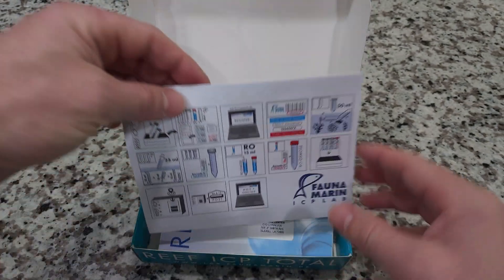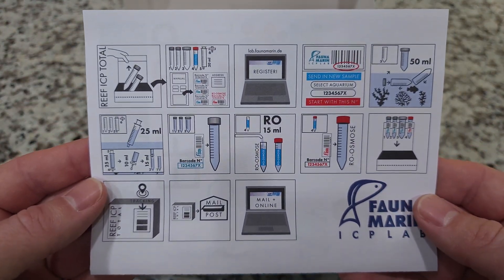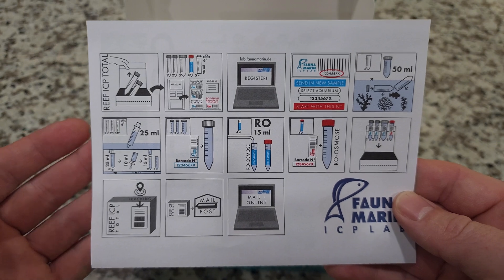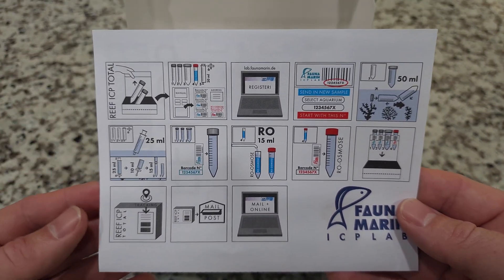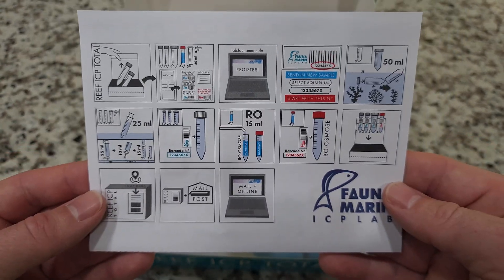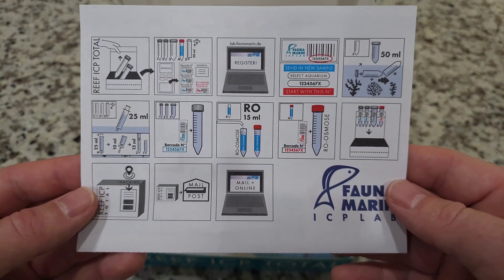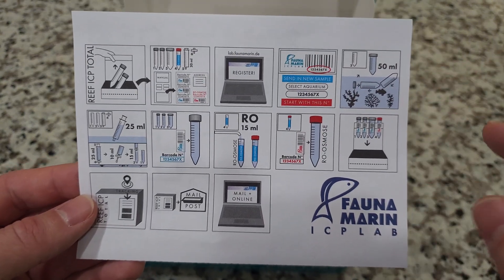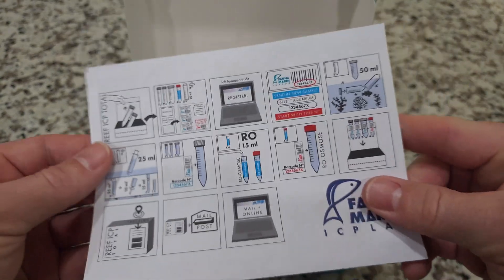The instructions look to be very complicated, but if you look at each picture individually, it breaks it down for you and it's really not that bad. We're going to go through it step-by-step and make sure that you have everything laid out exactly as you need it.